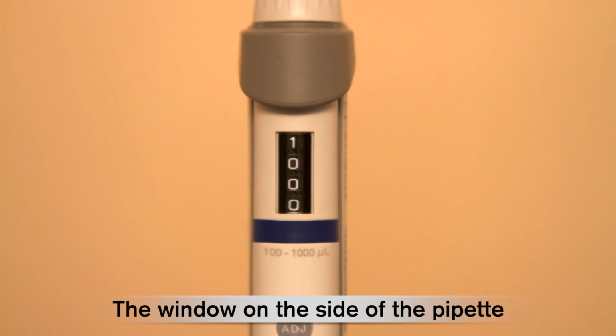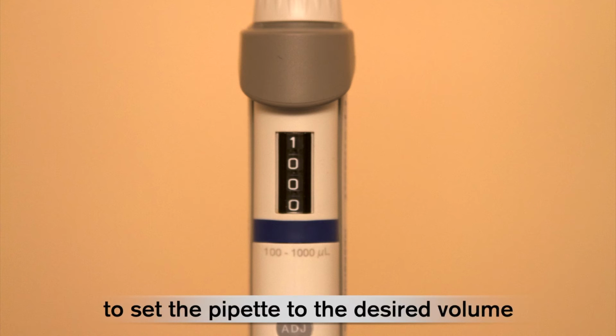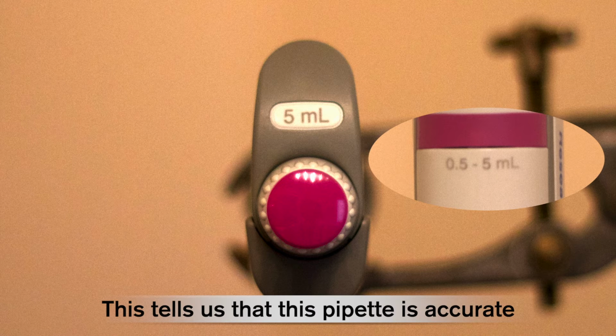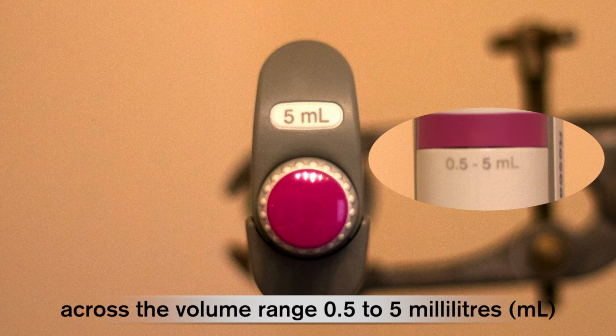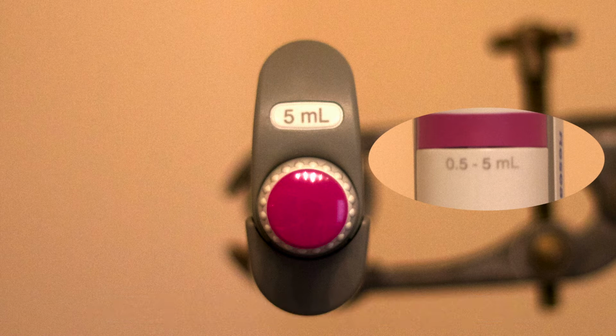The window on the side of the pipette displays 4 digits that are adjusted to set the pipette to the desired volume. This tells us that this pipette is accurate across the volume range 0.5 to 5 millilitres, which can be expressed as 500 to 5000 microlitres.